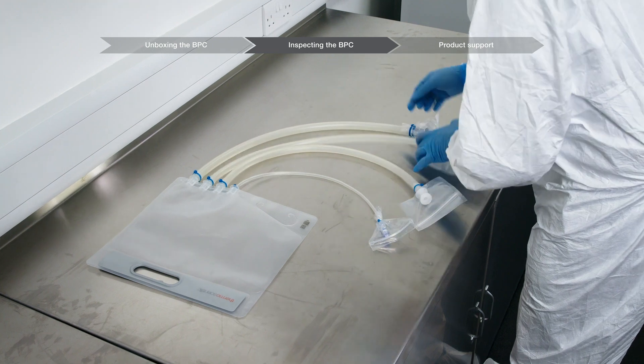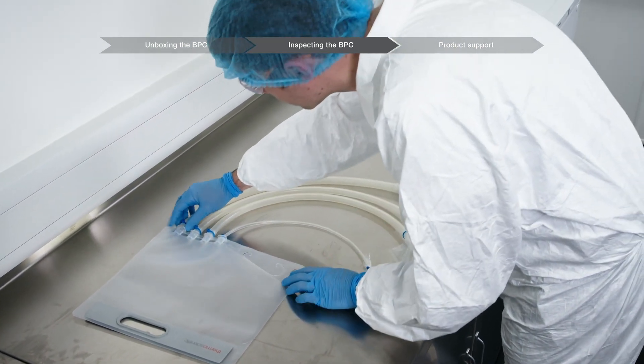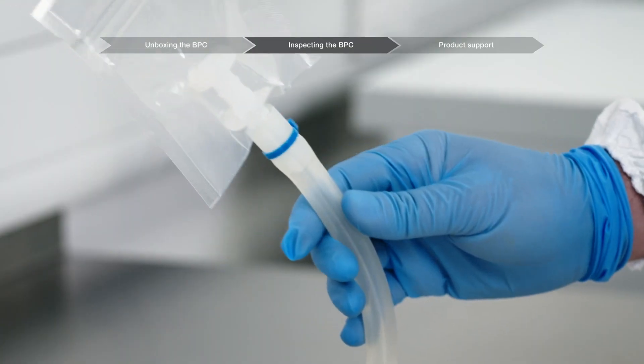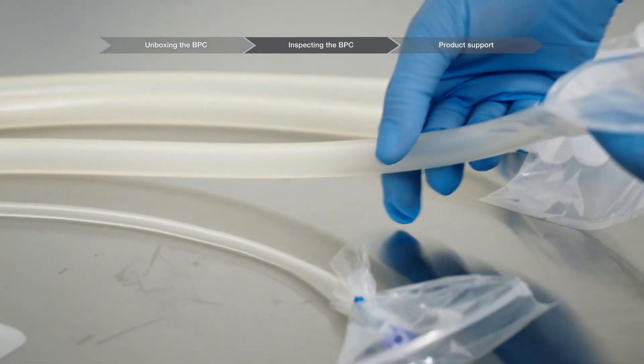Optional user inspections may be performed on tubing, connection points and connectors, and filters. Inspect the tubing for signs of damage or abnormalities.